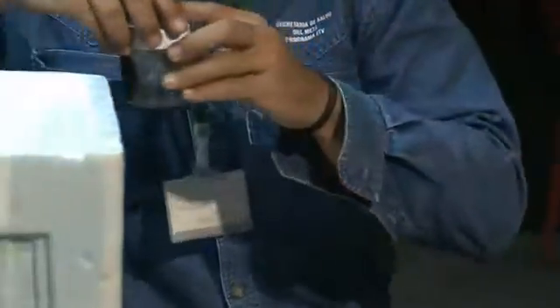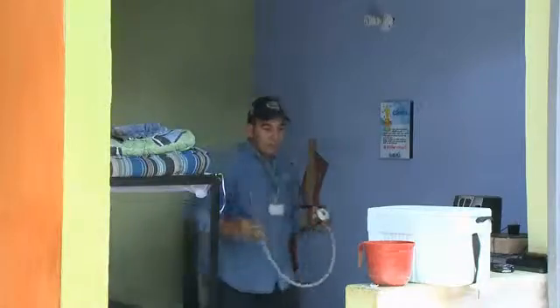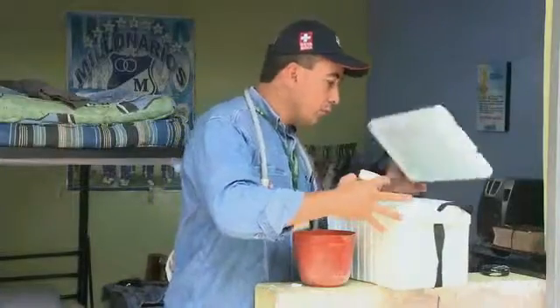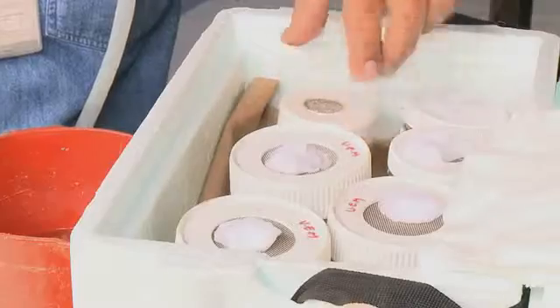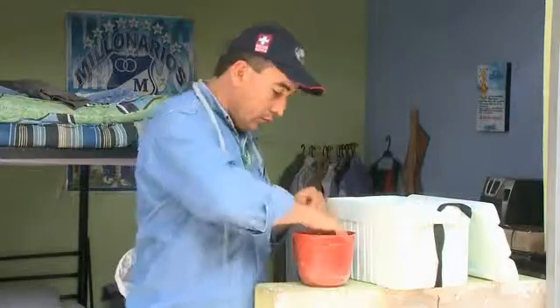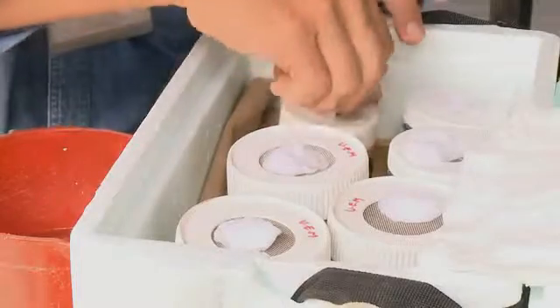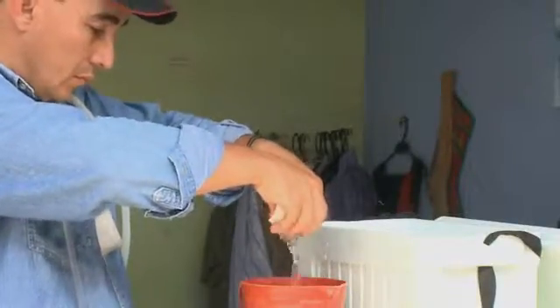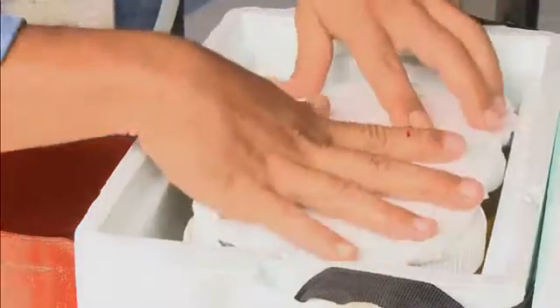To keep adult mosquitoes alive and prepare them for transportation to the lab, take the following steps. Place cups holding mosquitoes upright in a deep tray using a cardboard box or preferably an insulated box. Cover the cups with damp cotton wool. A 10% sugar solution can be added to the cotton wool to feed the mosquitoes. Cover the cups with a damp towel. Keep the towel damp until the mosquitoes reach the laboratory.